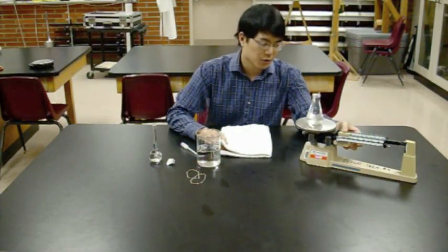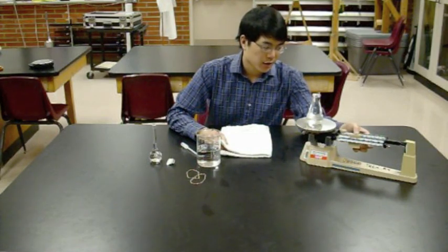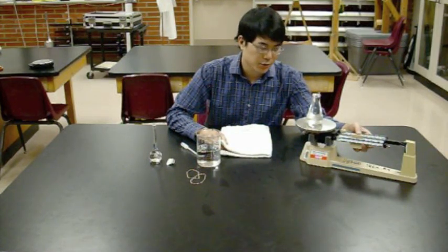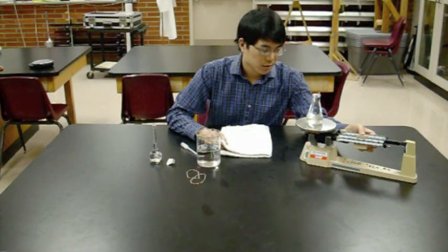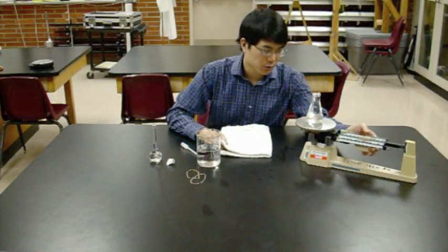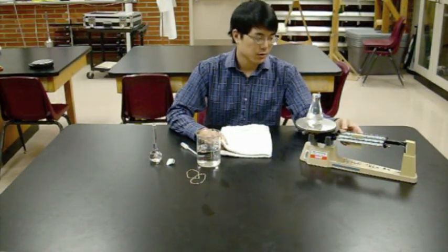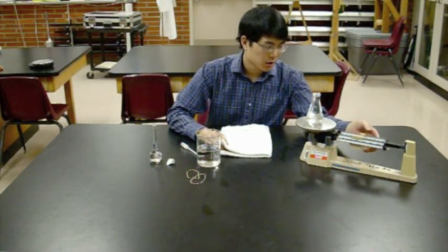Now we're going to get a substantially higher mass. Let's see. That's the 200 gram position. That's the 300 gram position. Tips of scales at 200. At 300. So let's get back off to 200.